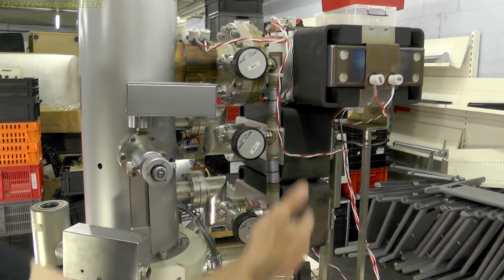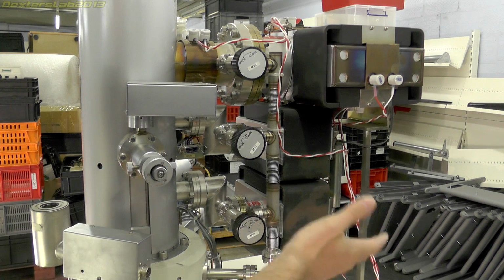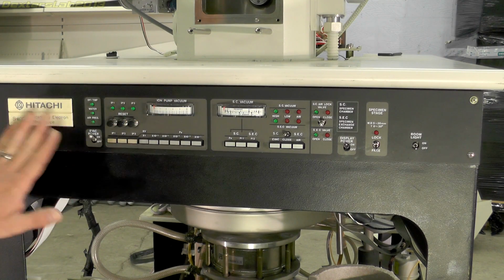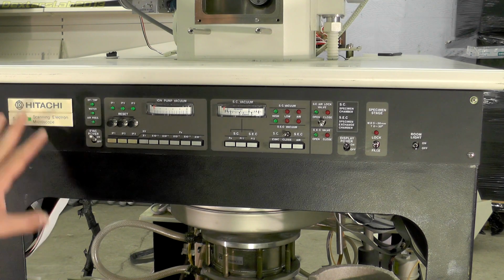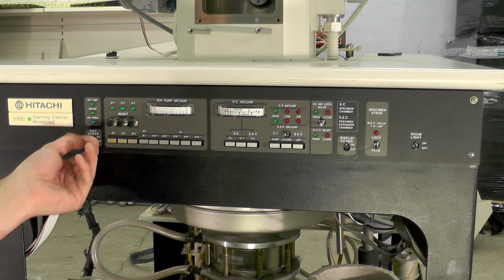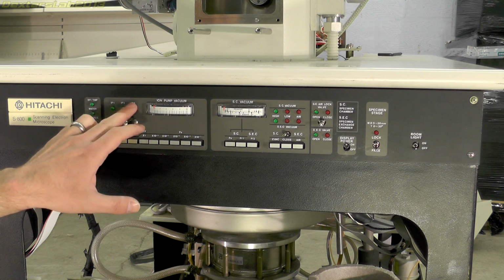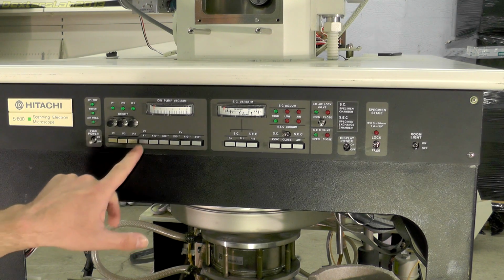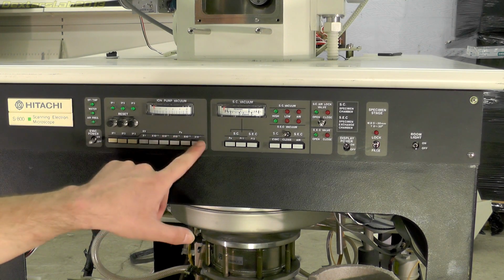And this is the piping that I mentioned before that connects the sample chamber to the ion pumps. There's a valve here, and then each ion pump has its own valve as well. And if we have a look at the base part, this is the front panel. These seem to control the vacuum side of it. I think everything else would have been done on that console that we're missing. So we have a number of things, evac power, so that would be the main power for the vacuum system. We have ion pump 1, 2, and 3. A gauge there displays as ion pump vacuum and a number of selection switches there. We also have a kilovolt thing here. I'm not quite sure what that means, but it's also related to the pressure.